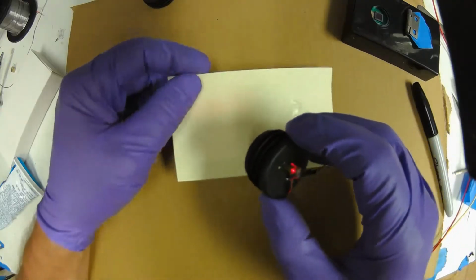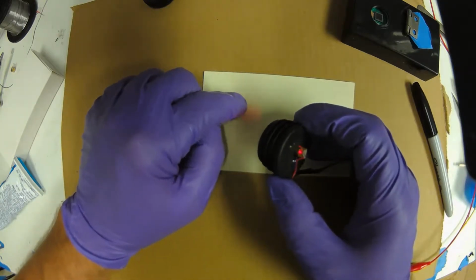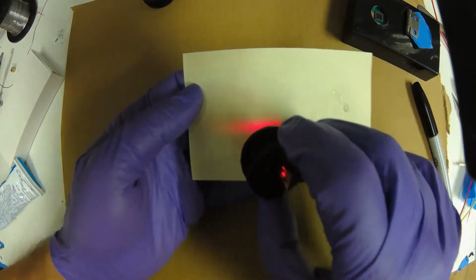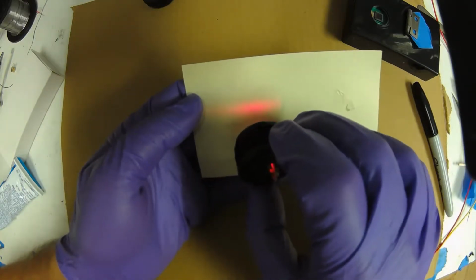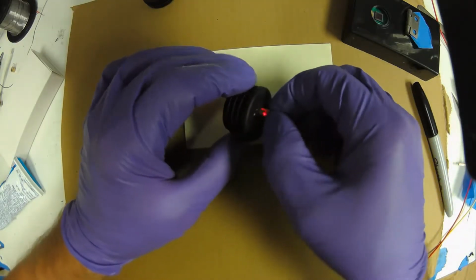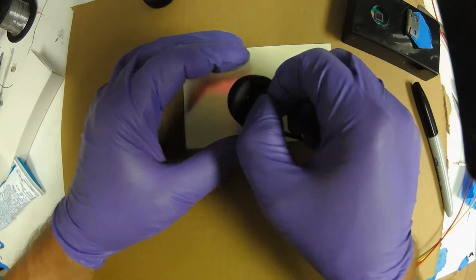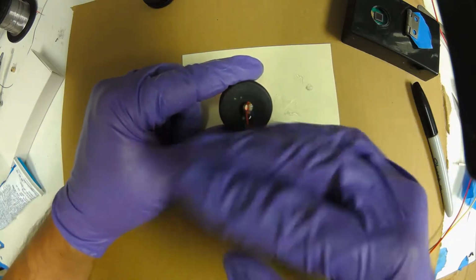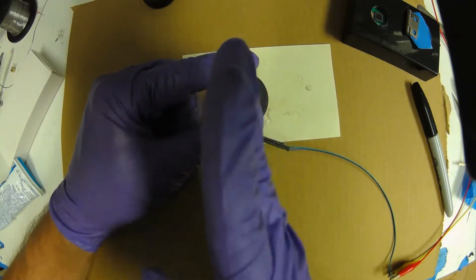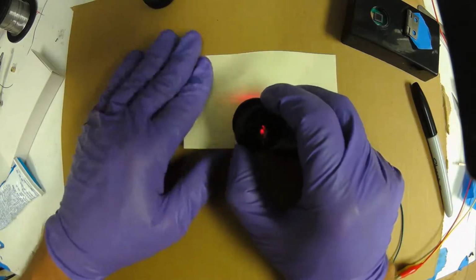Now, just to show you what the beam pattern looks like, usually you would have a tiny dot, but since we took the lens off, you'll notice that, can you see, I hope you can see this, that there's like a horizontal line. And let's look at the orientation. This package, remember you were pinching it like this, so use the circuit board as your orientation. The line is actually orthogonal, at right angles, to the line of the circuit board. So the circuit board's going vertical, and this line is going horizontal.